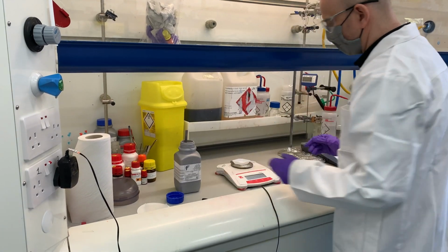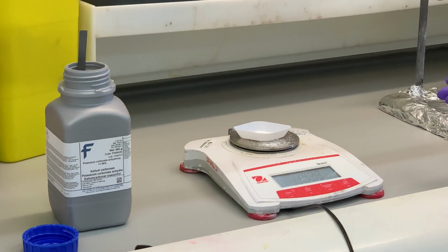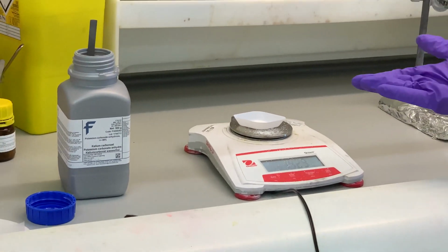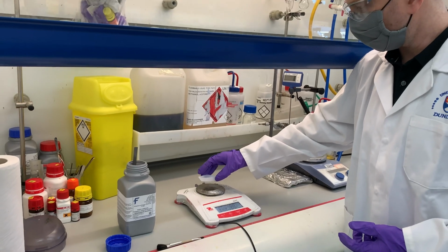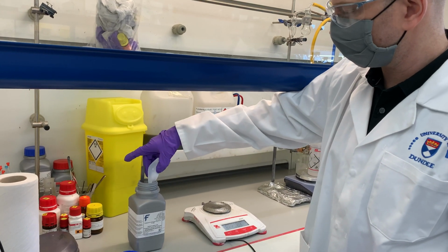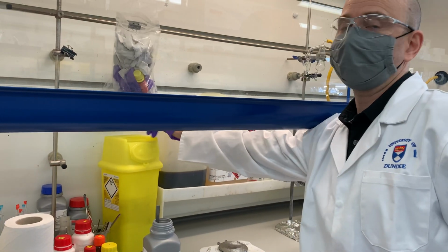And especially if you're a little bit sloppy, like I am here, you can see that it's all over the balance. It's on the pan. It's on the fume hood floor. It's all over the place. And what I'm going to have to do is get this all cleaned up before I do anything else. So first of all, I'm going to recover my reagent and throw away the contaminated weighing boat.